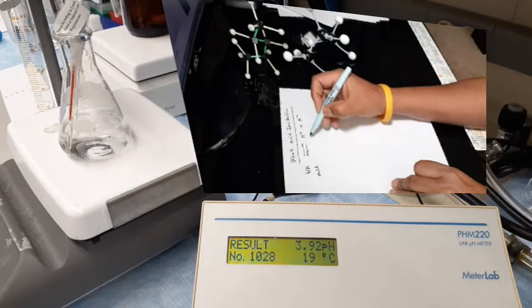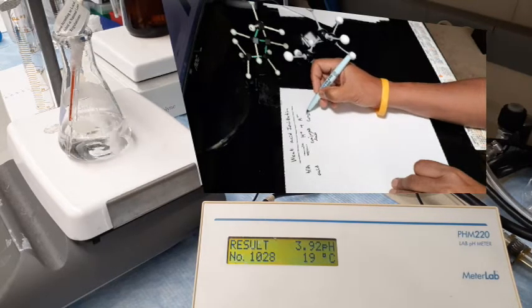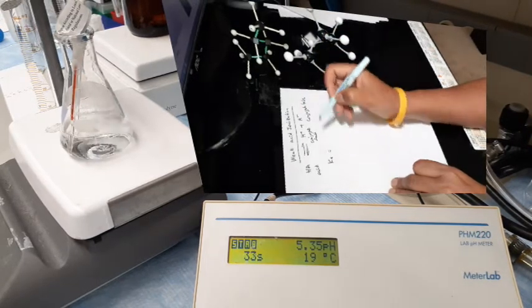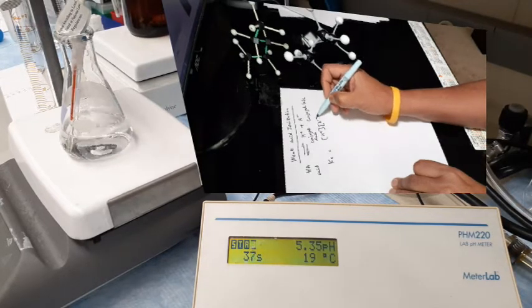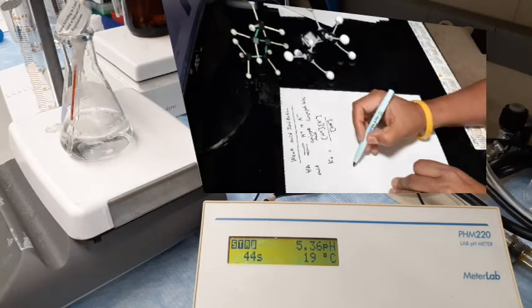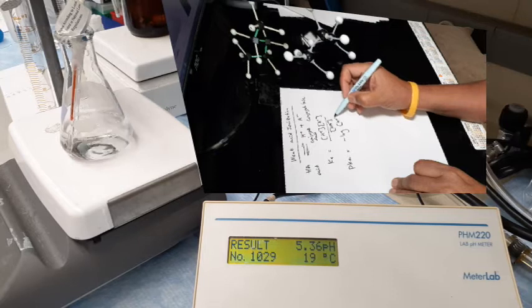At 34 ml of sodium hydroxide, we see a pH of 3.92. So it's slowly going up. This looks like the highest jump. It should be an equivalence point, because from 3.92 we are jumping to about 5.35. So it definitely shows a point where there is a proton exchange. That means an equivalence point of sodium hydroxide has been reached.